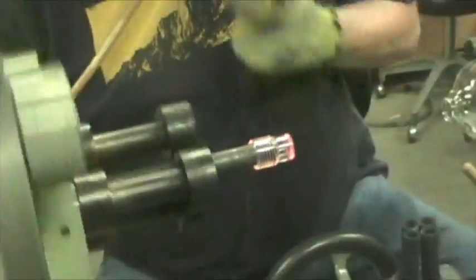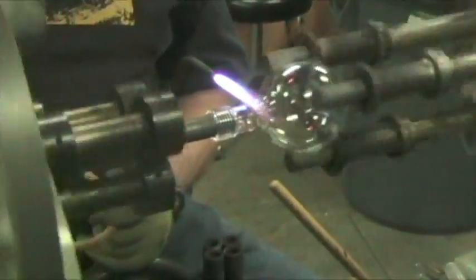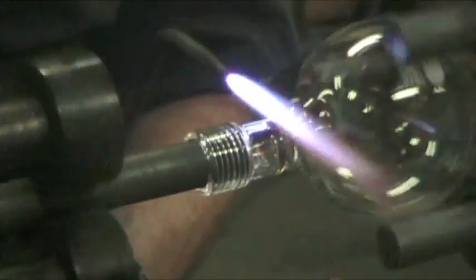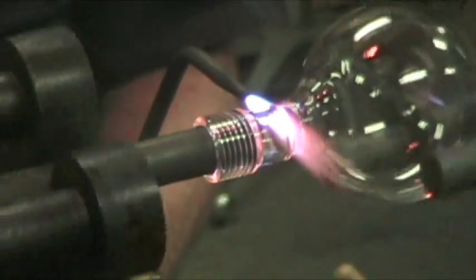So now the hose is heating. Both of these are about the same diameter now. Makes it easier for me to put them together. So I will attach this and then form it the way I want it. Then I've got to put a valve on it.